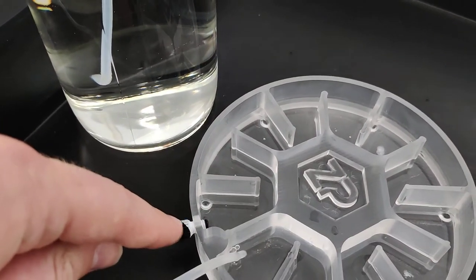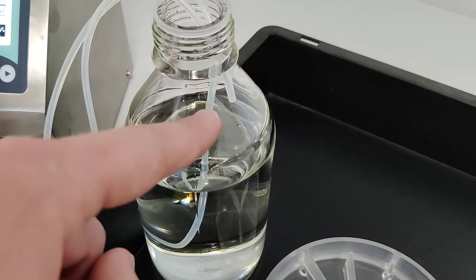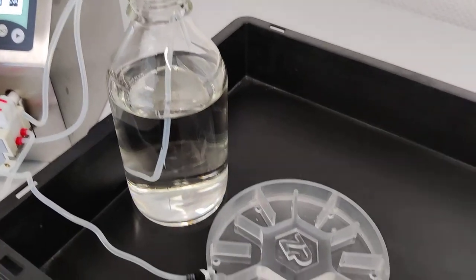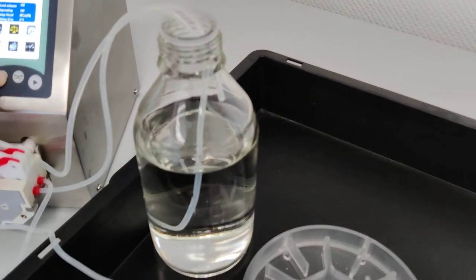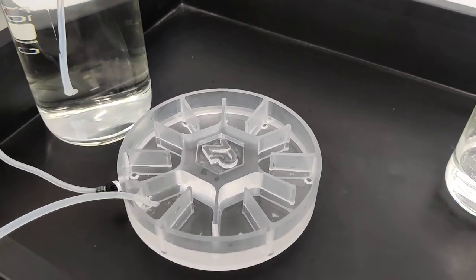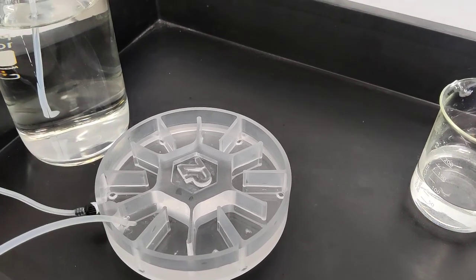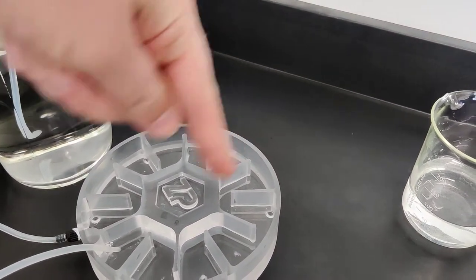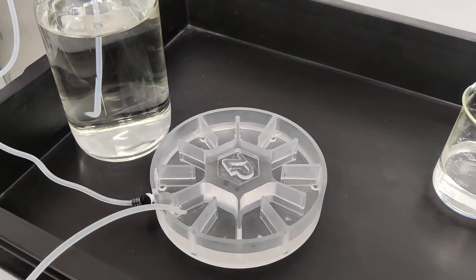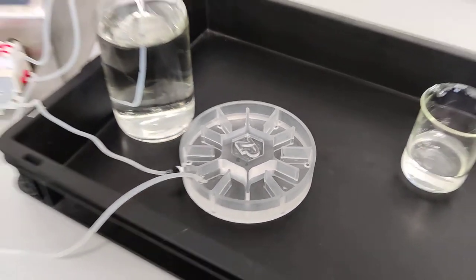And this fitting here will act as an extraction point, pulling that liquid out and back into the reservoir. And the advantage of this is that the evaporation will happen here in the beaker, so the liquid level in the flow cell will be kept constant. So with this setup you can set up a CP jig on top that will have sensors going down into each single chamber, and you can do a setup running for extended amount of time. So thank you for your help, Anna. This was a short instructional video on a typical flow cell setup. Have a nice day.